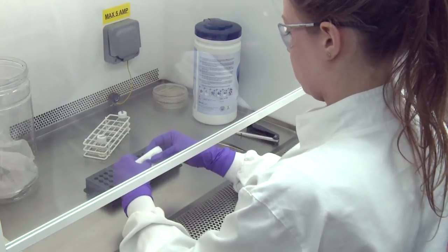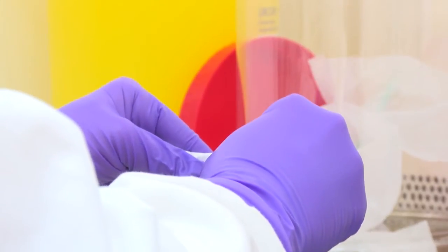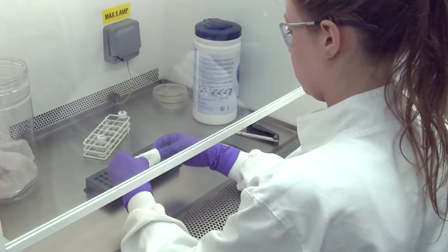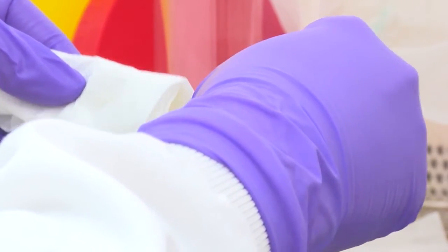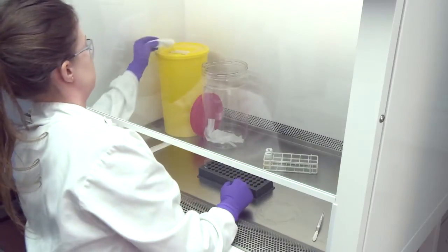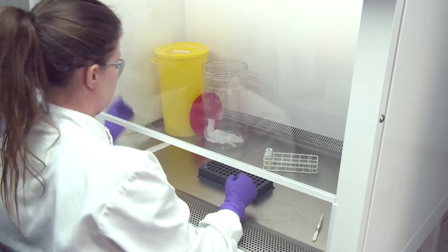Snap the ampoule whilst wrapped where the score mark was made. Carefully unwrap the ampoule, taking care as fragments of glass may be present in the tissue. Discard that tissue and ampoule tip into a sharps bin.